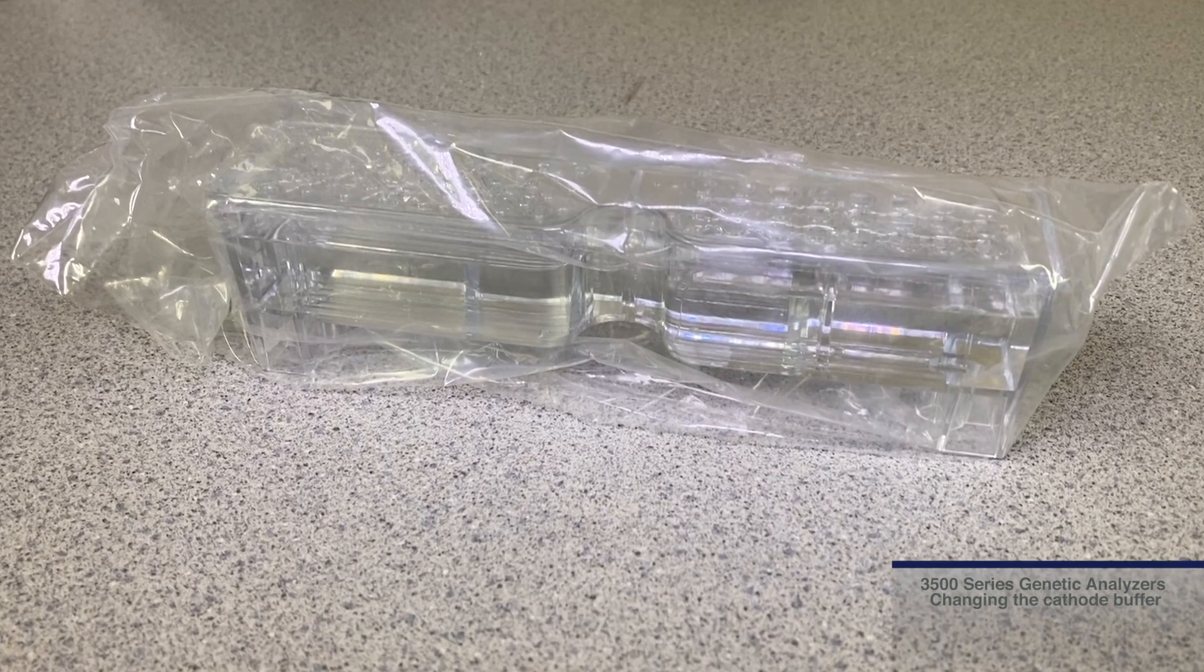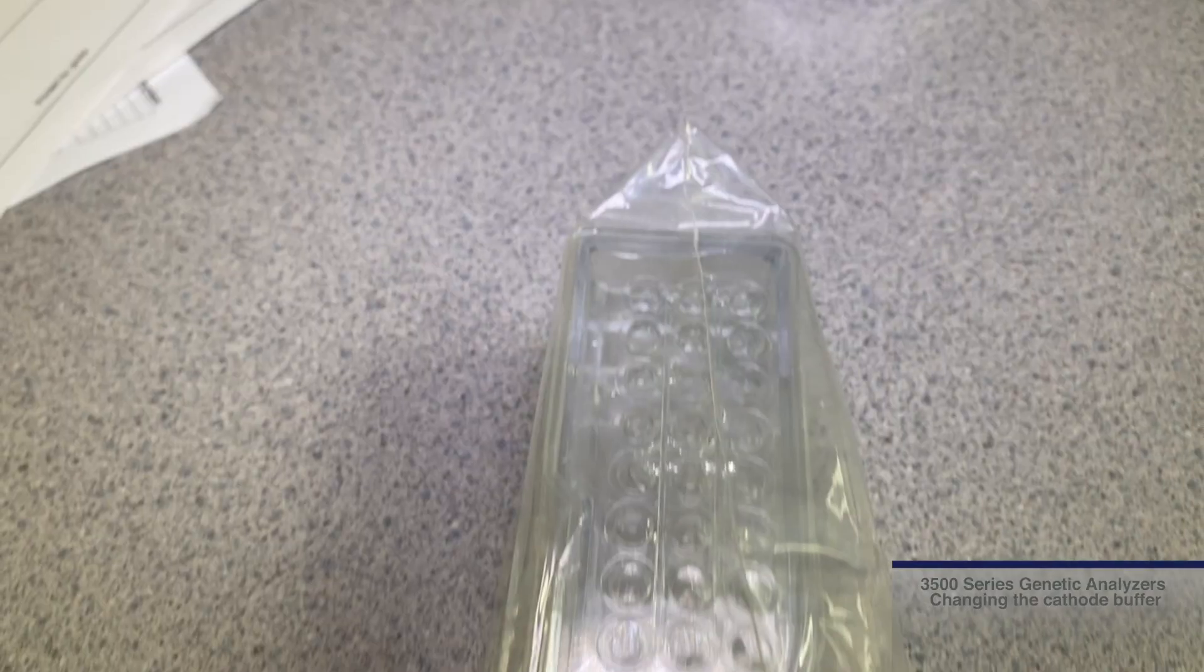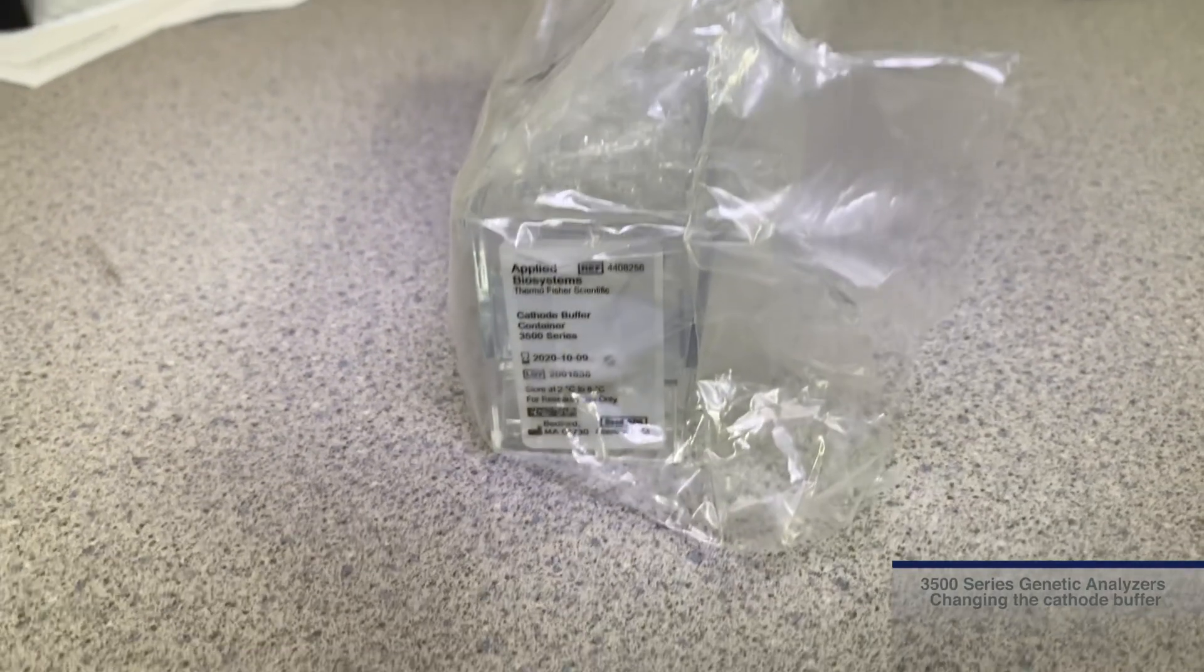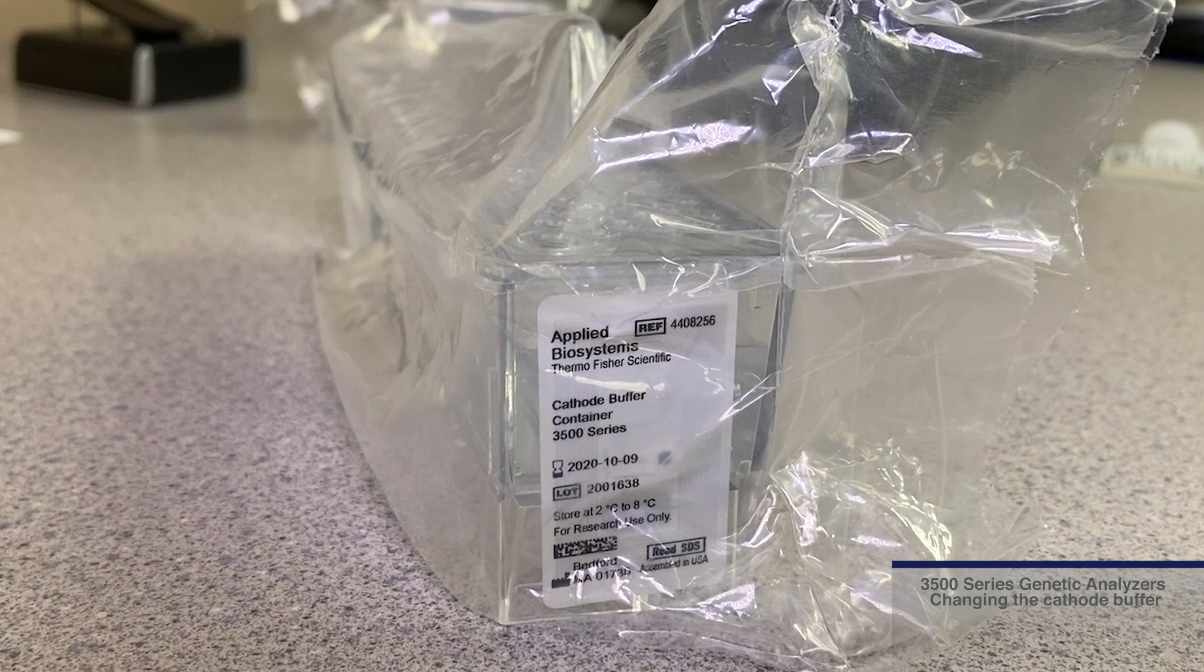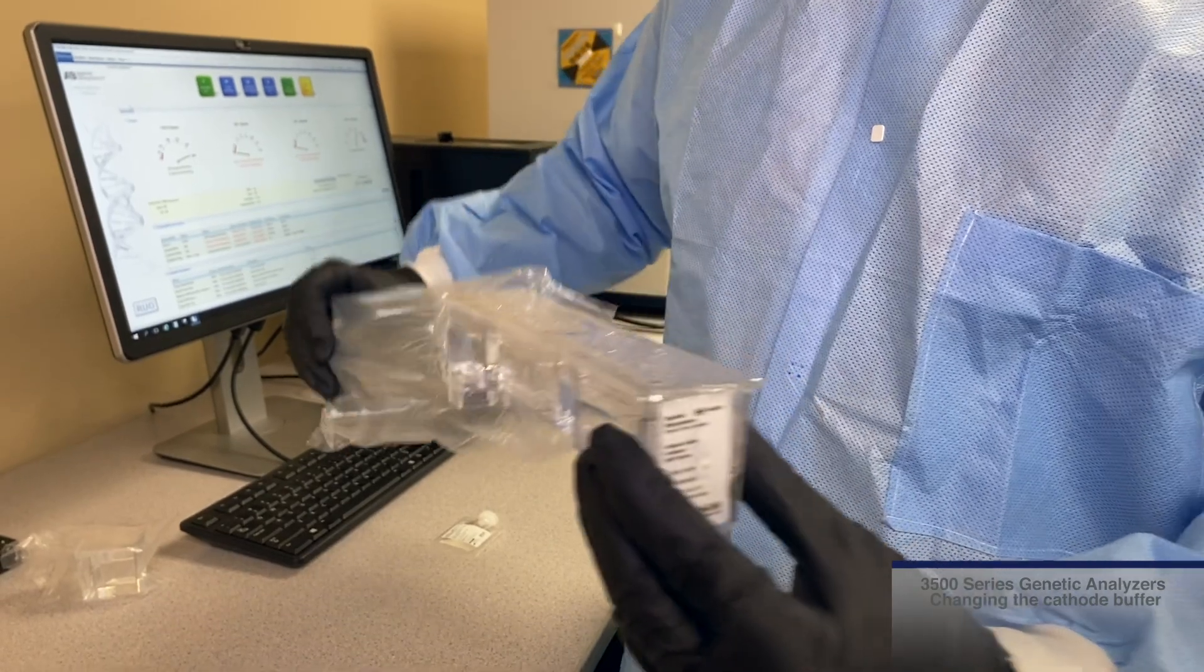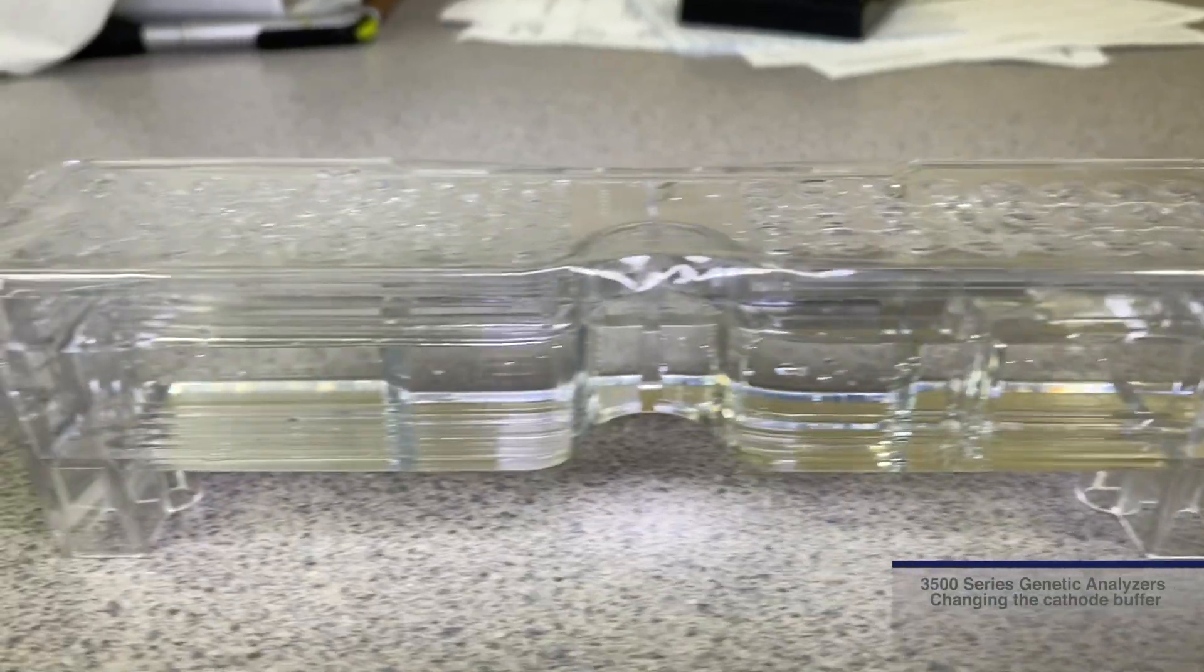The CBC comes in a sealed plastic bag. If any liquid is observed in the bag, please contact your local Thermo Fisher scientific representative. Remove the plastic shipping bag and allow the CBC to come to room temperature.